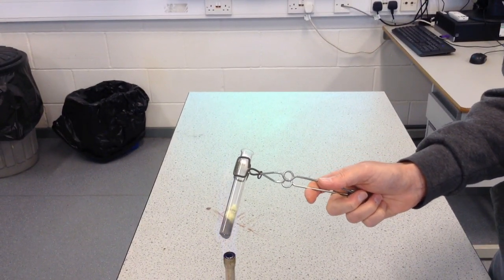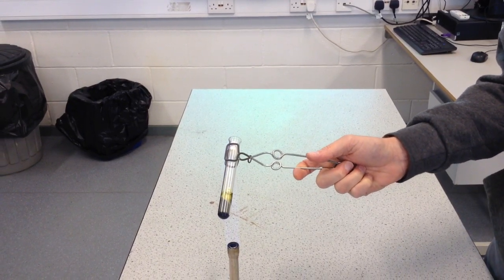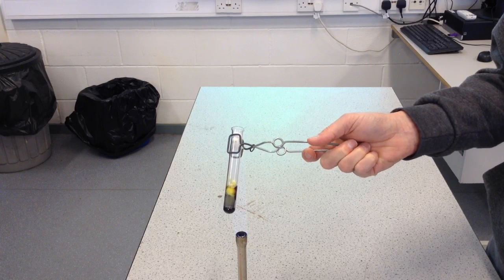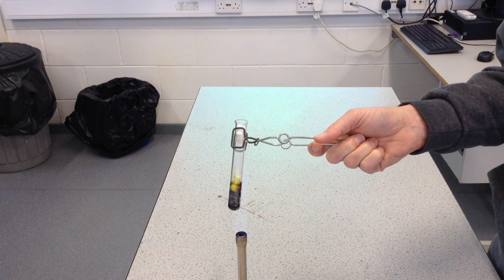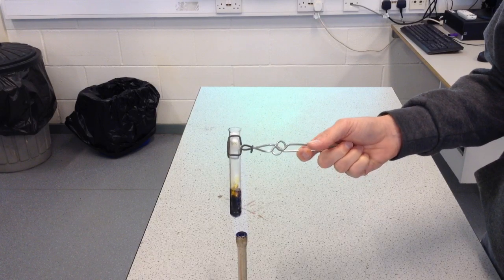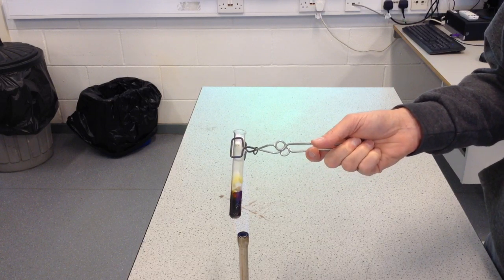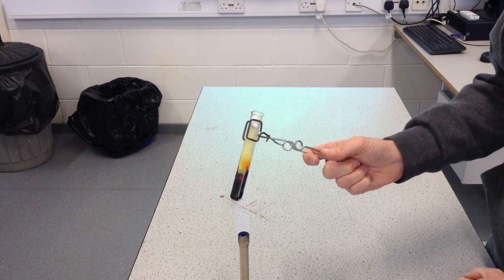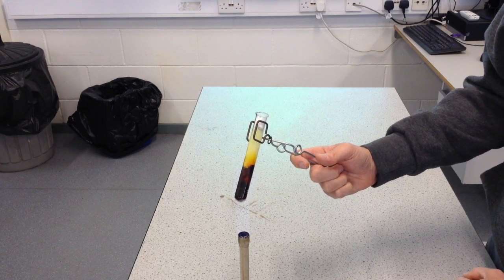We're looking for any signs of a chemical reaction, a chemical change going on. The first thing I'm seeing — I'm hoping you can pick this up on the camera — is that there's a colour change. I'm seeing something that looks really quite reddish. I'm also getting a rather unpleasant smell, even though I've tried to bung up the top a little bit with cotton wool. But hopefully you can see that red colour — it looks like it's becoming a liquid as well. There's a red liquid going on, and some of the sulphur powder is jumping up and sticking itself to the top. Hopefully you can see there's a very obvious chemical reaction going on here — red colour, liquid, and certainly an unpleasant smell.